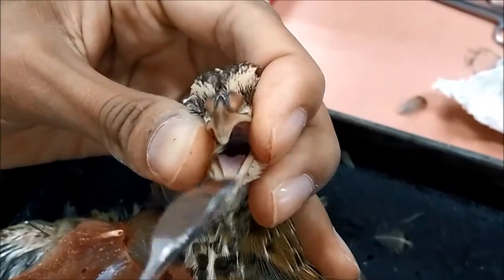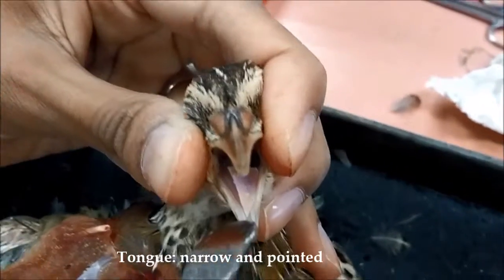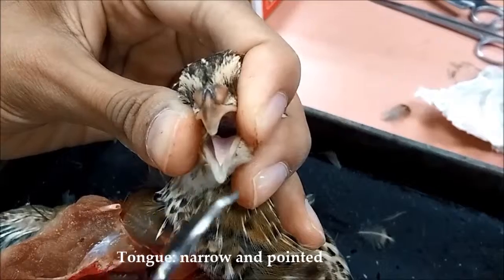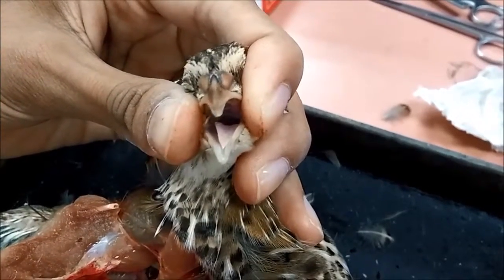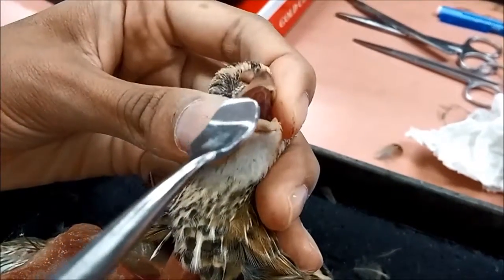So next, this is the tongue of the bird. It has a pointed shape, as you can see here. And birds actually don't have any teeth. They are toothless.